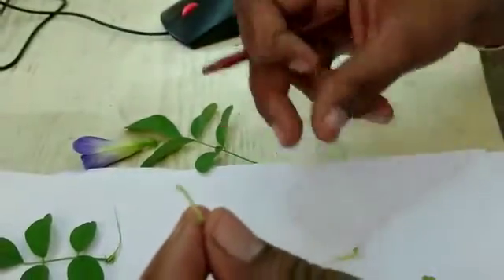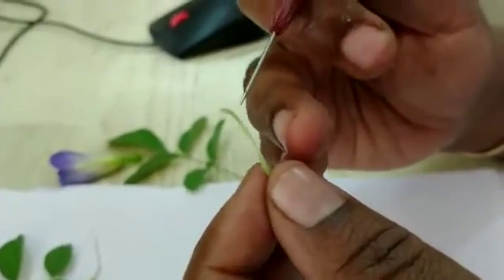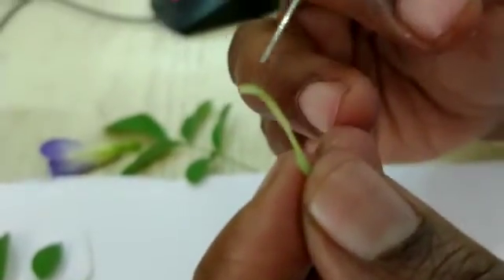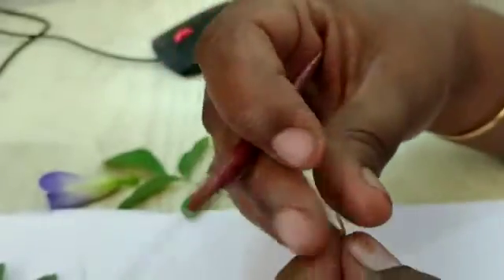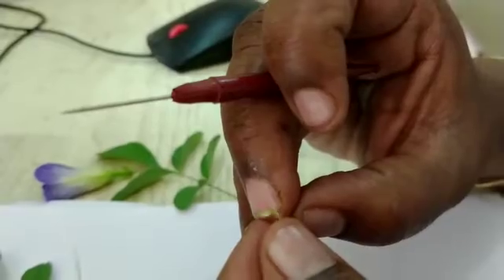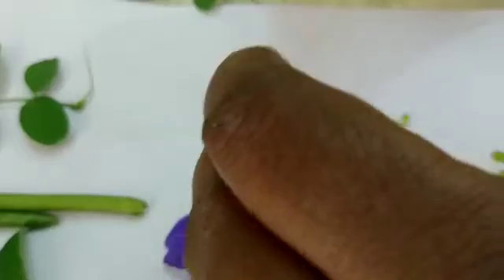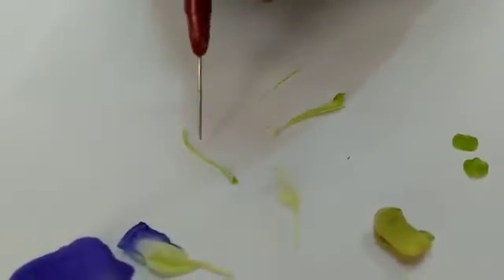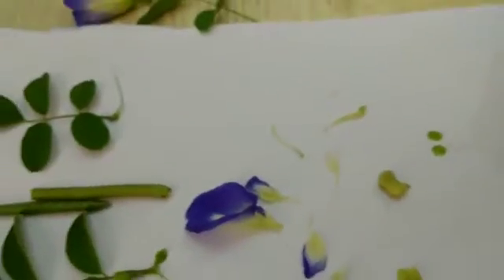The gynoecium has ovary, style, and stigma. It has a feathery stigma — you can see the hair-like outgrowth. The ovary is at a right angle to the style. While making the diagram, note this orientation. In pea it can be seen nicely. This is the ovary, style, and feathery stigma.